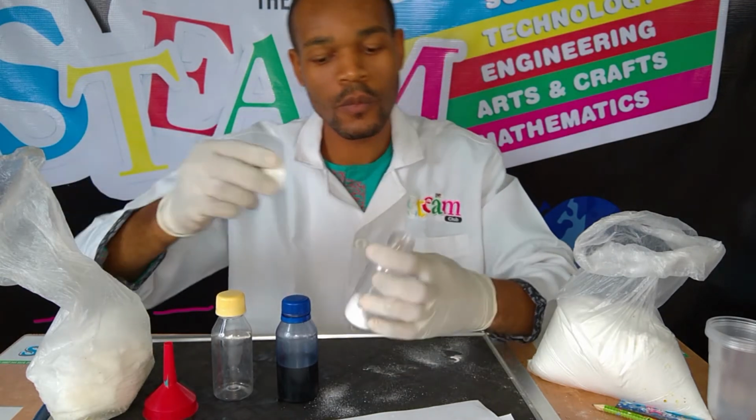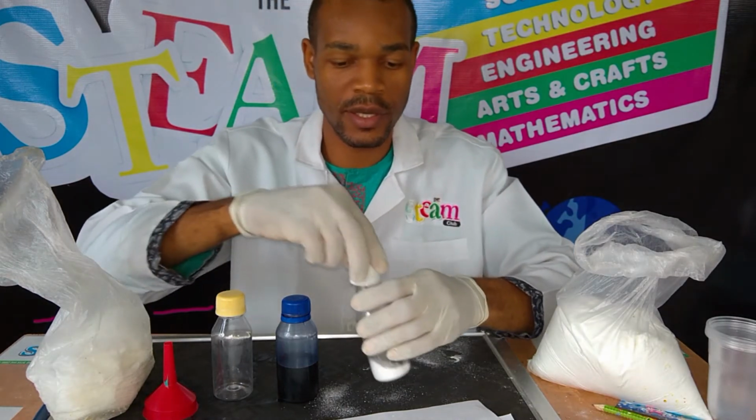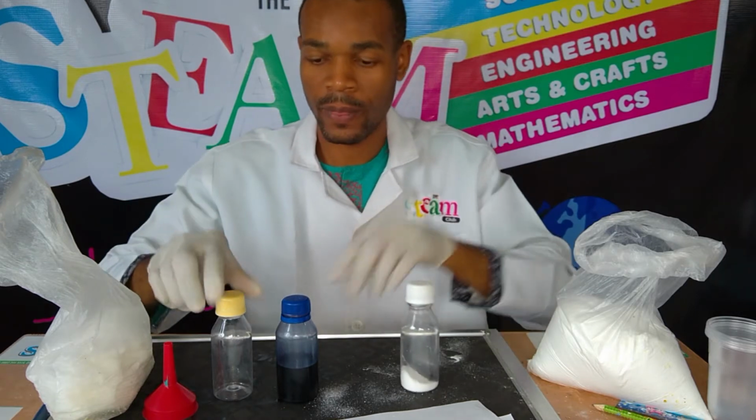Alright, so I have about 10 grams in here of glucose.